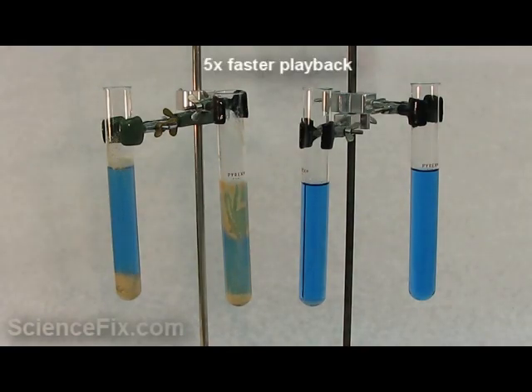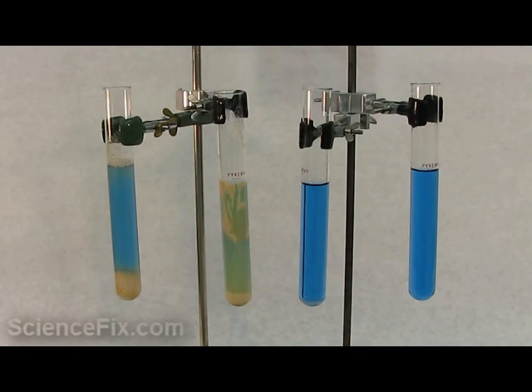This produces carbon dioxide gas and water. Now we are showing the test tubes at five times faster than normal playback, and you can see the test tube second to the left looks like it's producing some carbon dioxide.